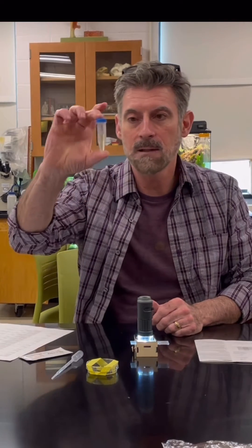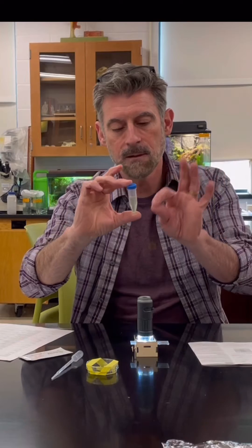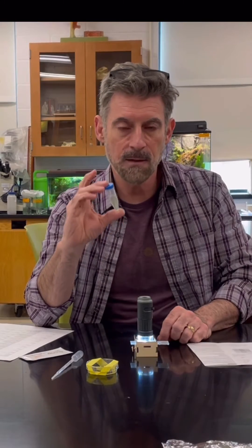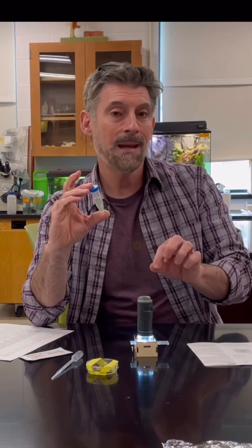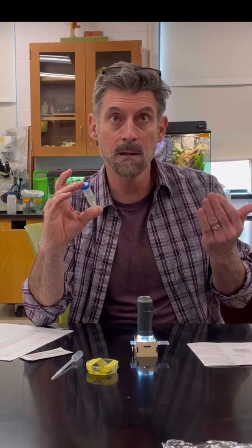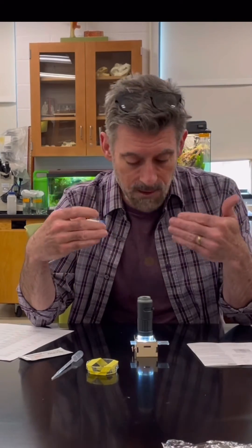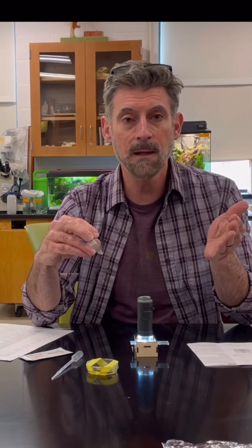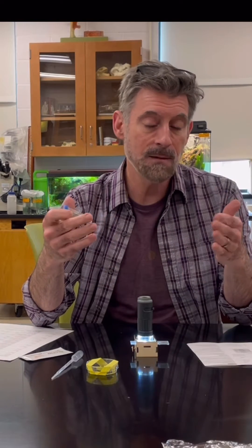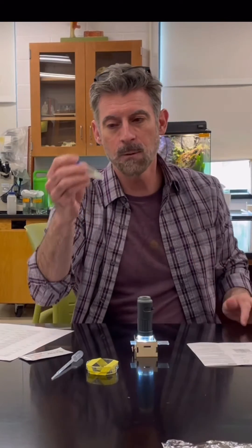One of the things you're going to have in the lab is an algae culture in a little tube - you need to pick that up separately in class. You're going to use it for experiments and you'll be counting the cells in the algal culture on this slide. The next thing I'm going to show you is how to use this to focus on and count the cells and what they're supposed to look like - because sometimes students look at something under the microscope and they're not looking at the right thing at all.